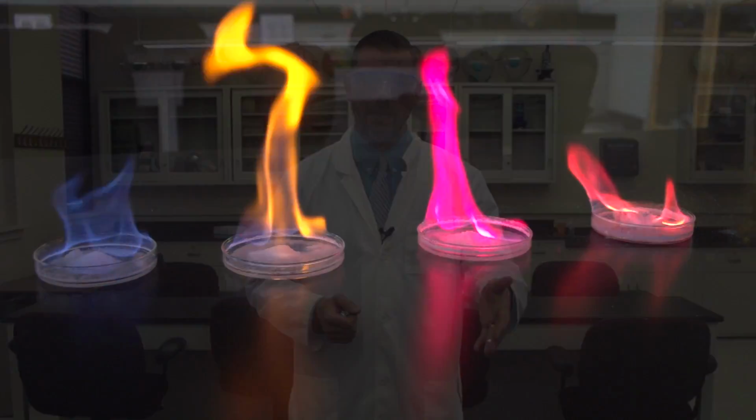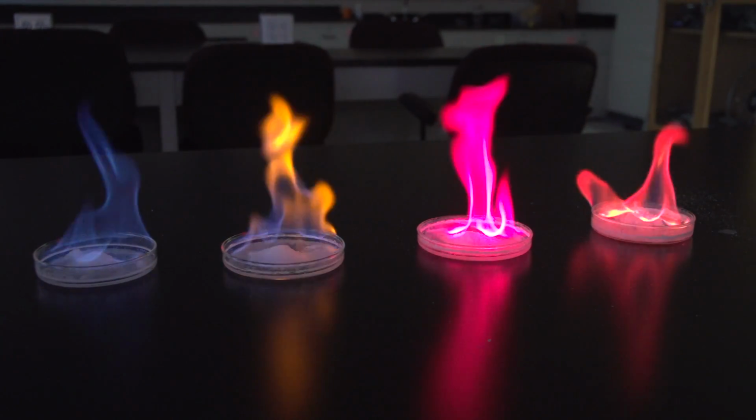And we also learned that light has distinct patterns and waves and energy to it that is consistent with the different colors. And we can see this more keenly by looking at these elements and their flames, I should say, through a spectroscope where we can keenly see the distinct lines and measure those differences among the particular elements.